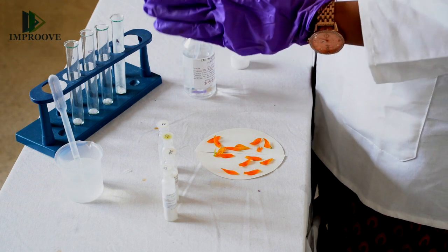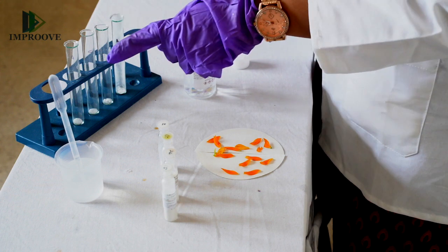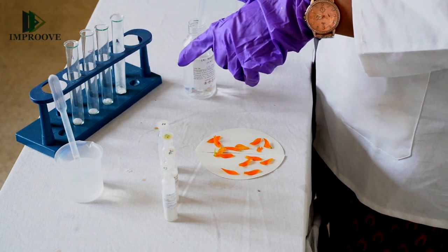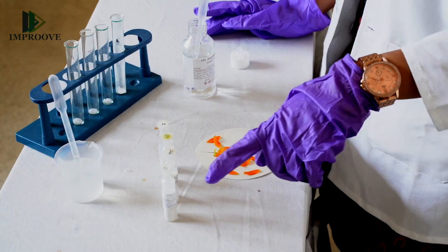Label the test tubes as A, B, C, and D. In each of these test tubes we will put four different salt samples. In one of them we will put calcium hypochlorite, which is your bleaching powder.